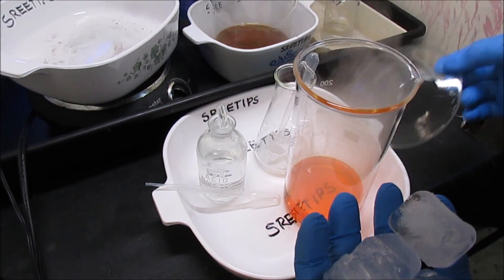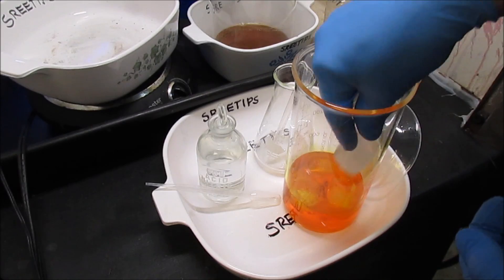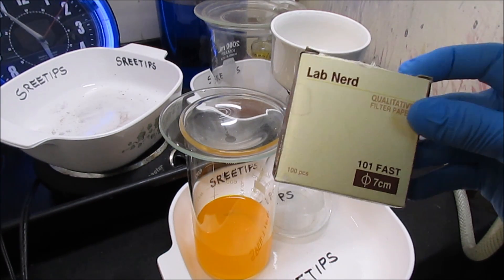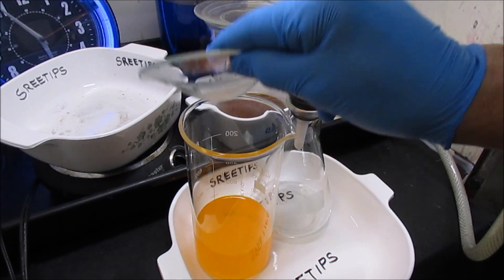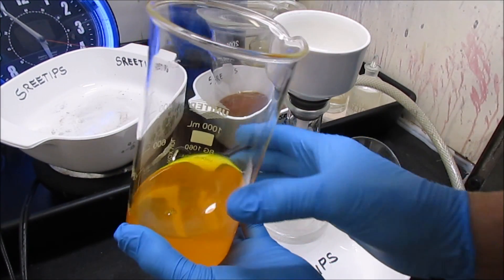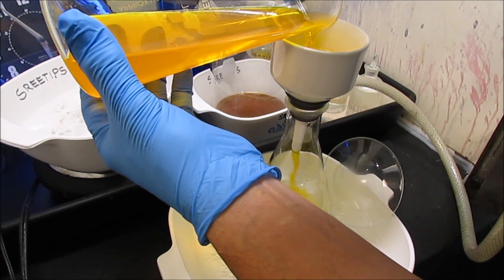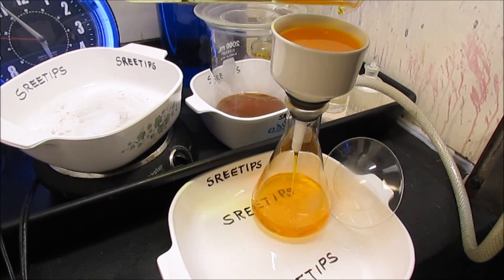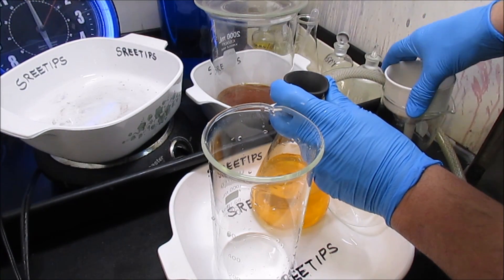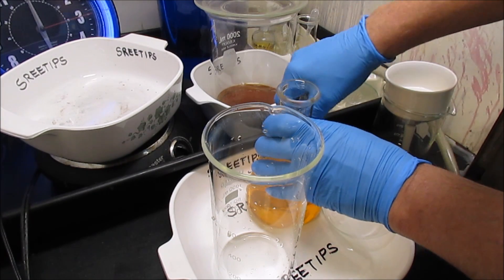I'll add a few ice cubes to get it to cool down. I'm using the number 101 fast filter, because that's all I have right now. There's some silver chloride or something in there — it's cloudy — so I'm going to go ahead and pour it through a filter. After filtering, there's still a little bit of cloudiness. I'm going to pour it into this beaker, which I've rinsed out well, and go ahead and precipitate it with some stump out.